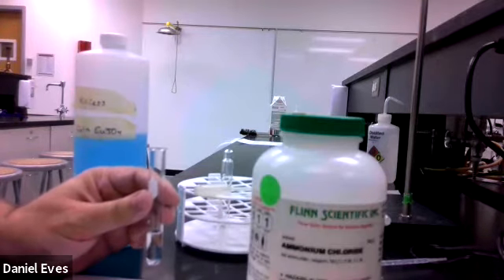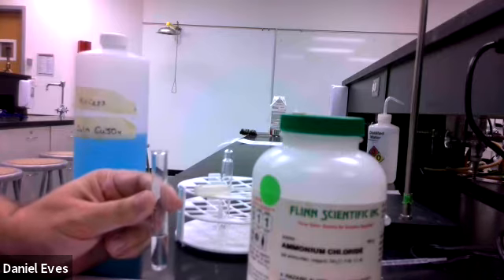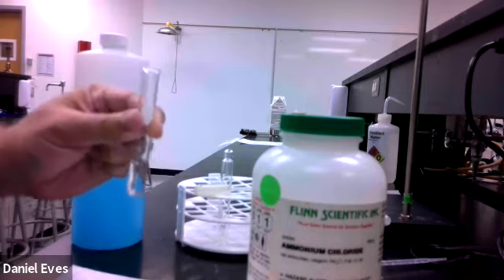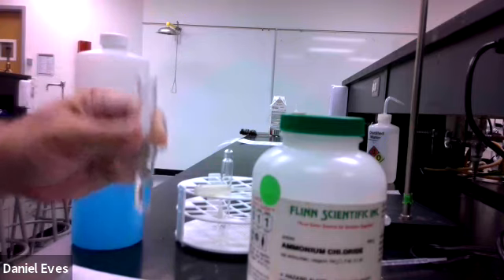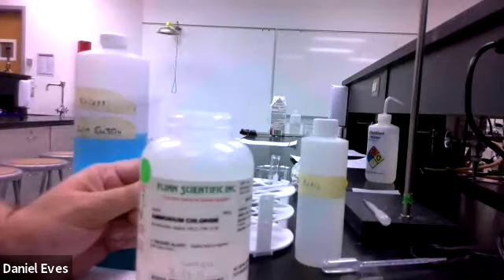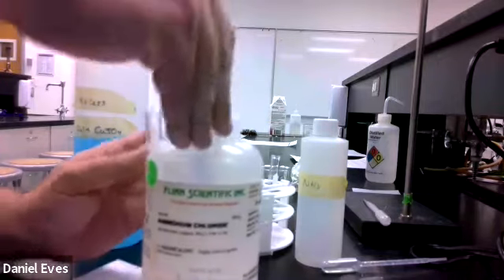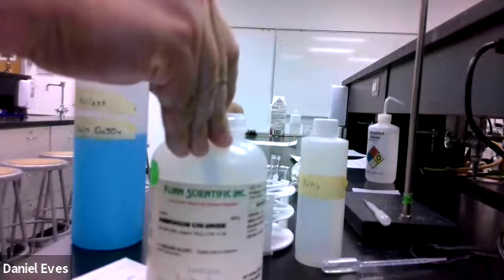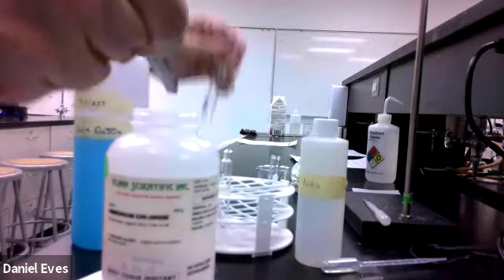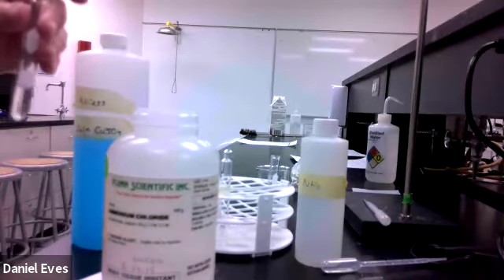Okay, the next lab experiment we want to do is use the ammonium ion and figure out its equilibrium. So we're going to go ahead and try and dissolve ammonium into this 2 milliliters of water. So here is my jar of ammonium chloride, and I'm going to get myself a sizable scoop just to make sure. There we go. Give me a scoop of the ammonium chloride and try to dissolve that as best I can.